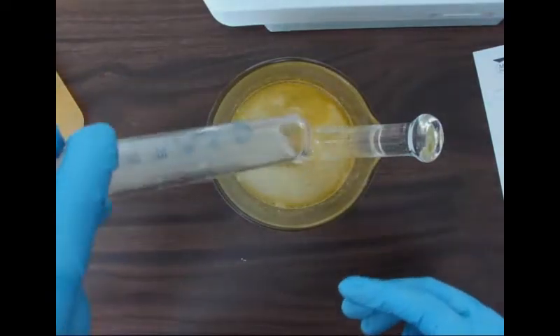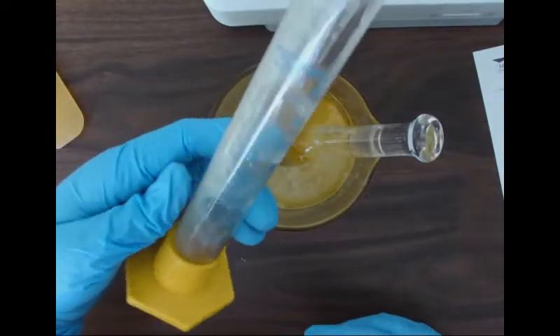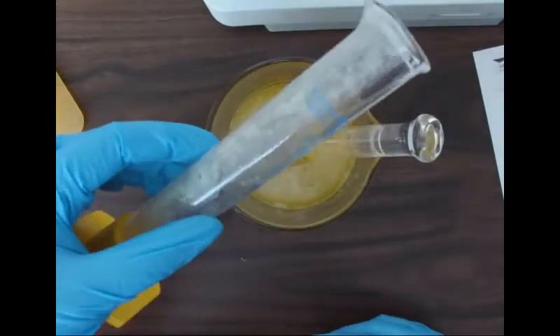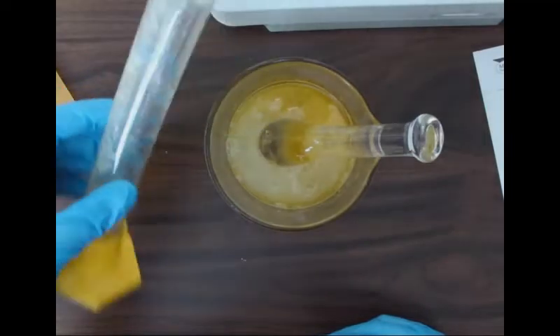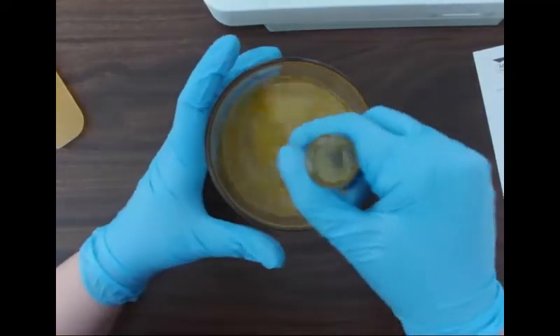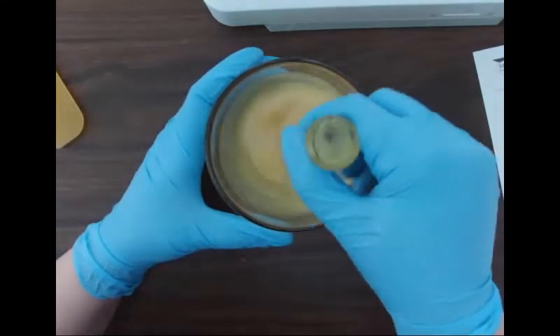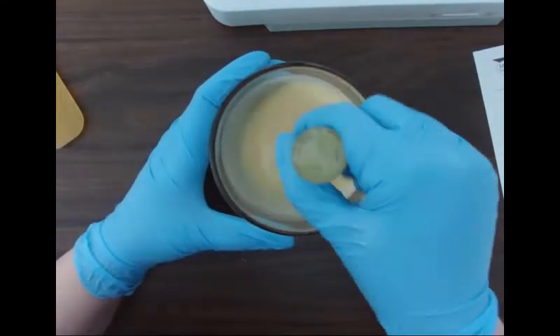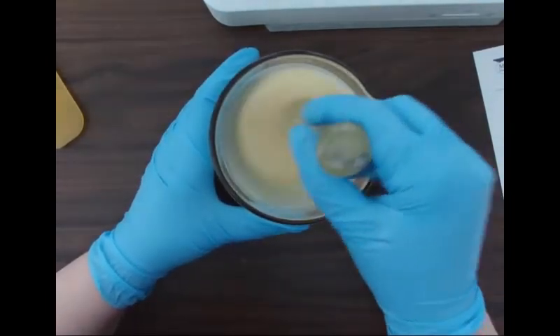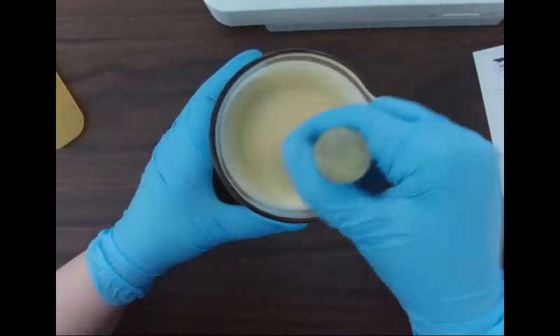Okay, so I had to do 2 additions because I only took a 50 ml cylinder home. This is just me showing you that, again, it goes solid quite fast, so this is kind of an annoying day when we do it in lab. There's a small film of that part B in all of the cylinders that we have to try and scrub out.